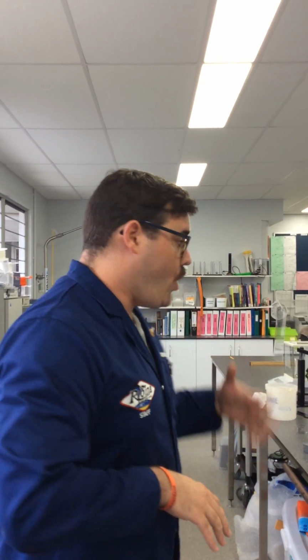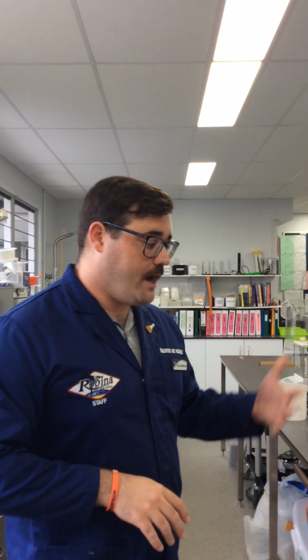A couple of things to keep in mind when we do this experiment, okay? These are things you're going to have to consider if you are planning your own experiment, and also if you're writing it up, which you will be doing. Think about why we did everything we did. Why did we use a water bath? Why did we use high precision equipment? Why will we have done 3 replicates? All those sorts of things.